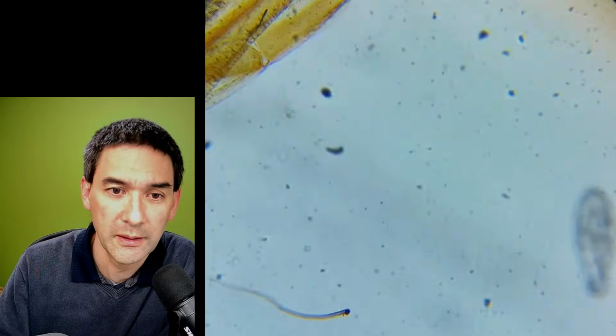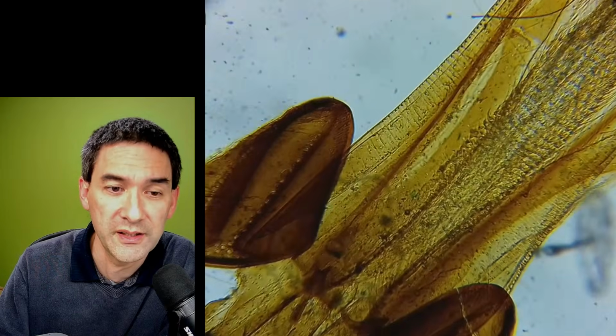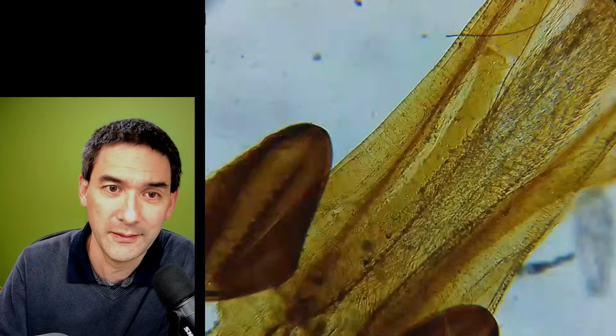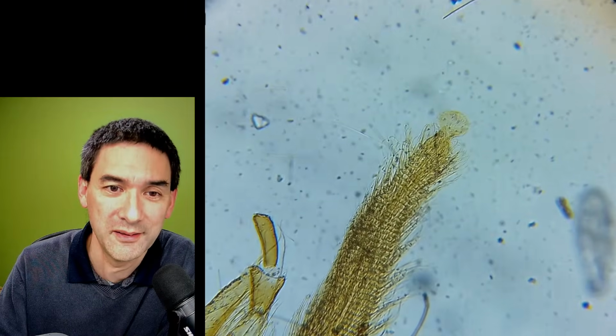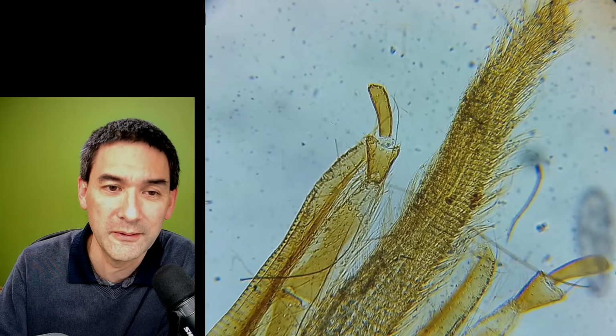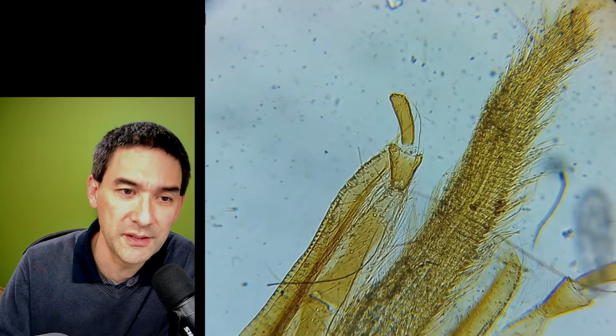Really, I mean, considering the fact that this microscope was around €100, it's an introductory microscope also for children, but still, I'm quite surprised by the image quality that you're getting. So this is over here. Of course, where it's too dark, it's very difficult to see.